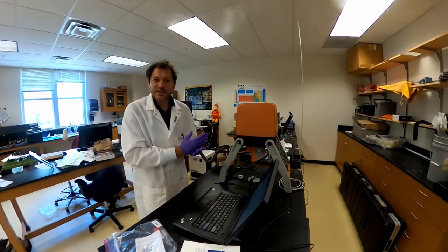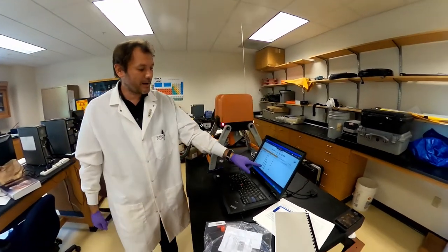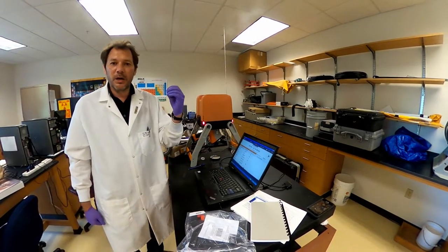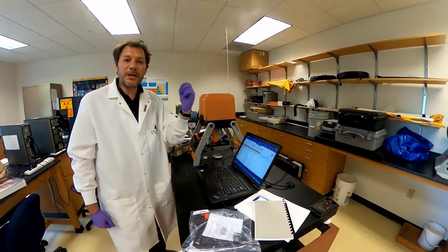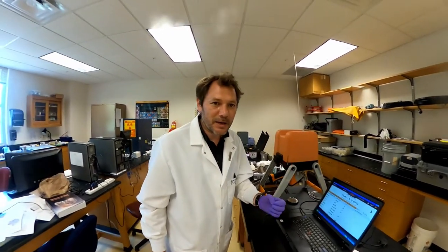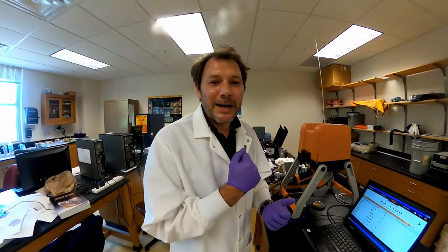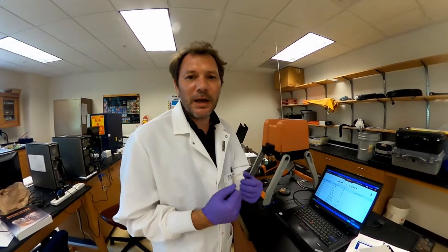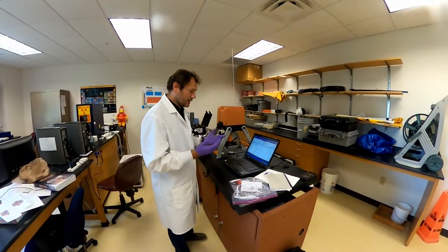And it's very likely that some of these samples will be very high, some lower. But we are at a value of 766. It will change a little bit during the measurement. And I want to already throw in the mix there that EPA considers that any value that is above 400 for a soil is not suitable for a play area. I have a 10-year-old kid. He grew up in this house. He knows extremely well that we cannot play in the dirt in the backyard unless we play far away from the property and we wash our hands extremely well. And here it's done.